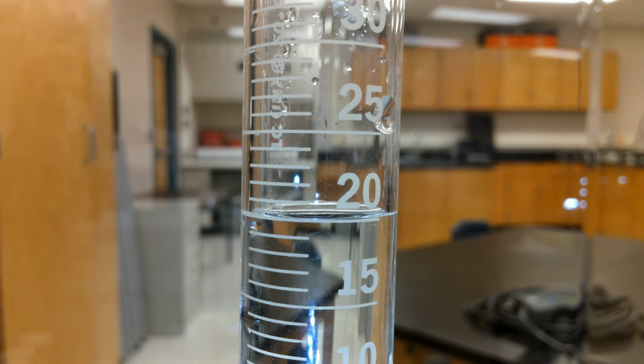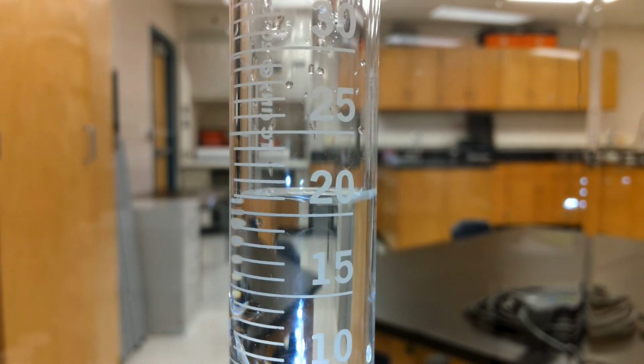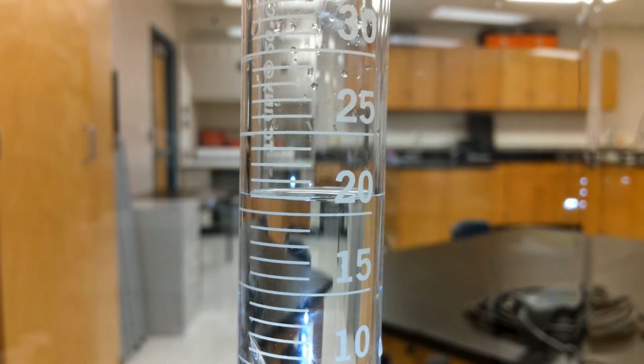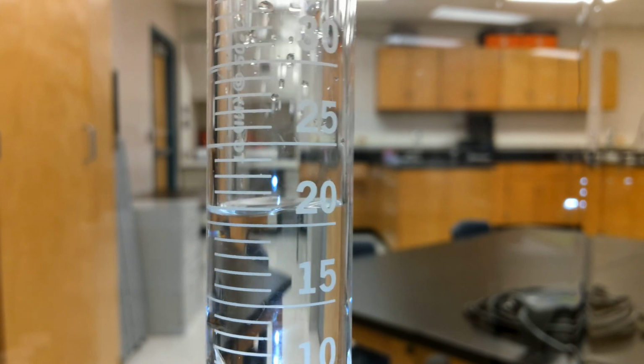Okay, and then we're gonna do the last one, suspect E. Remember to look right under the meniscus. Oops.